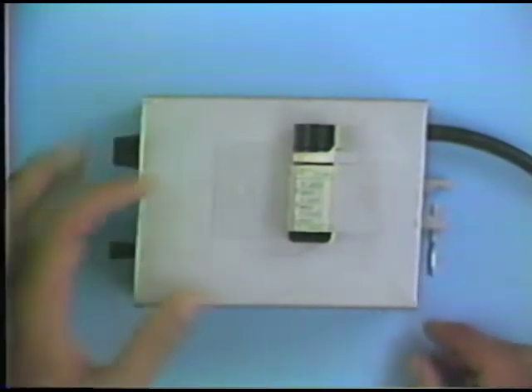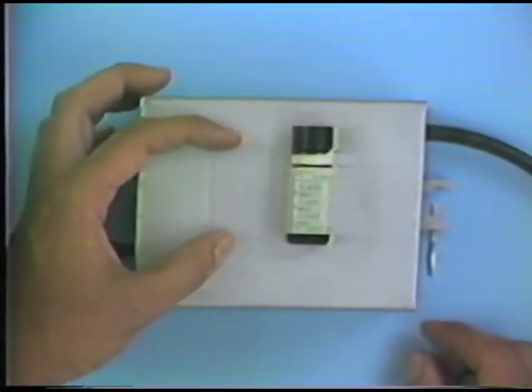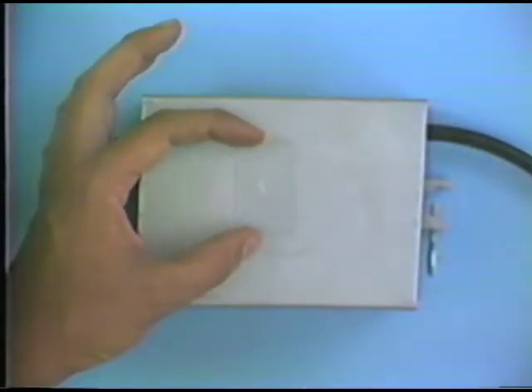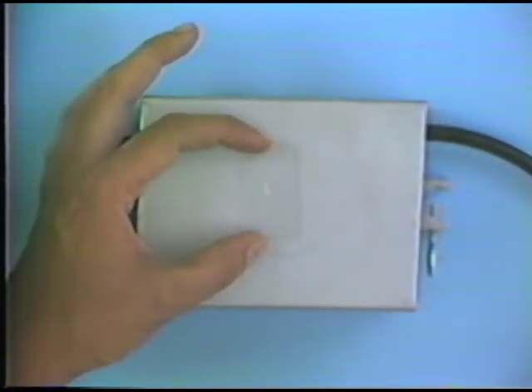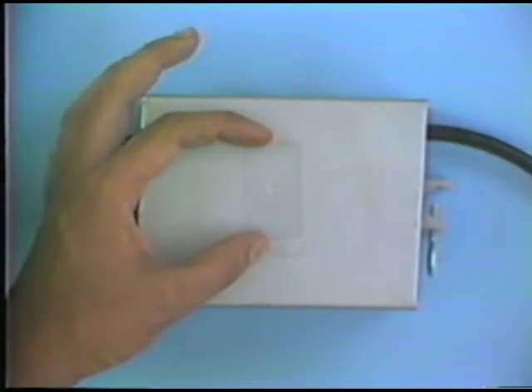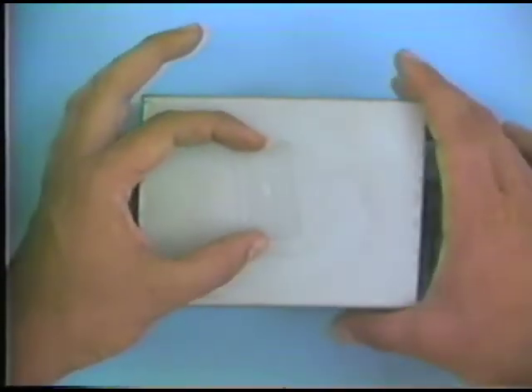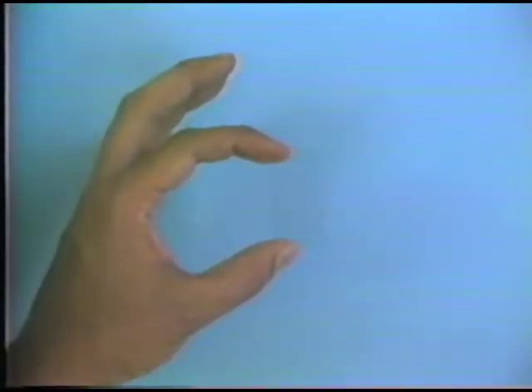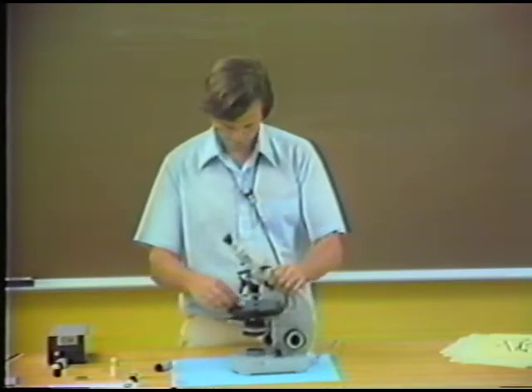Just as an example of this, I've got this mount on a hot plate, and the hot plate is turned up so that I'm actually heating the mount now to raise the temperature of the immersion oil. So if I take this, which has sat now for 30 seconds on the hot plate, you can see a very noticeable difference in the oblique illumination test for this particular mount as we observe it now with the microscope. So I'll move the microscope back.